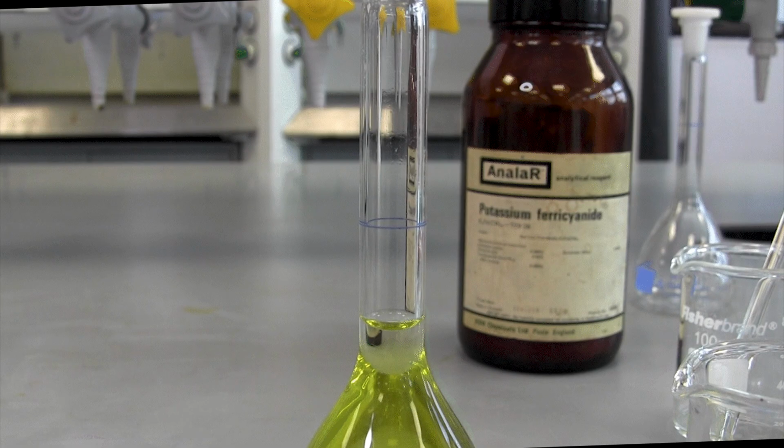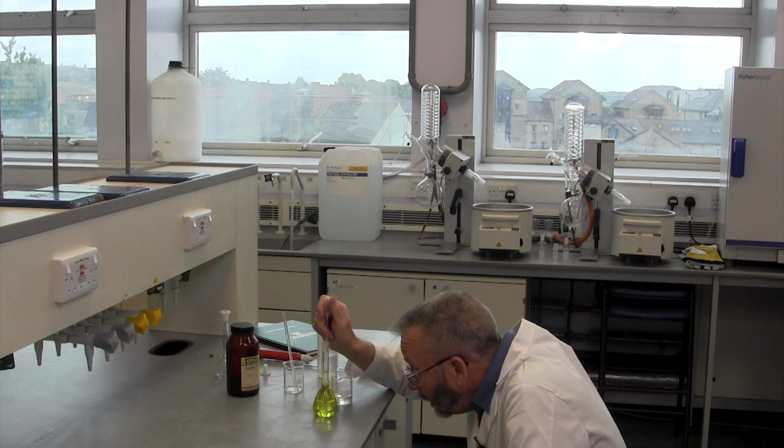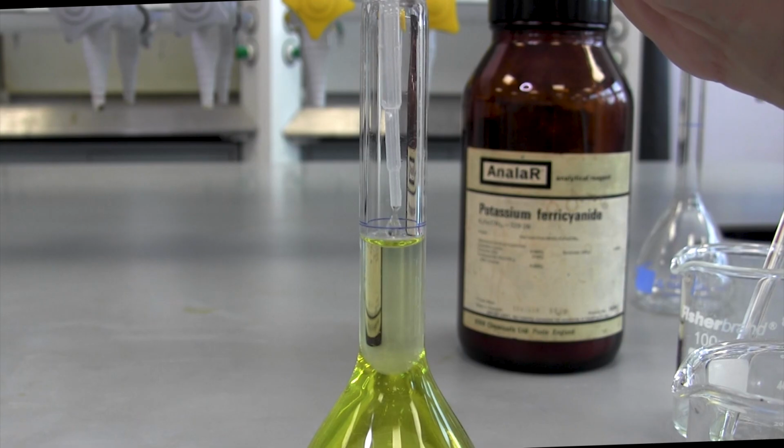The volumetric flask is made with a narrow neck so that small additions of liquid result in relatively large changes in the level within the flask. This volumetric is designed to measure 100 millilitres accurately, so the line on the neck is at this volume. Hence, we need to add water to the flask until the level, in particular the bottom of the meniscus, is on the line.